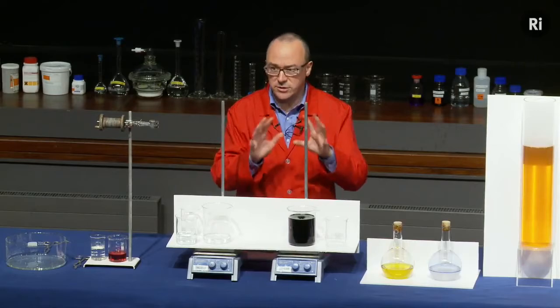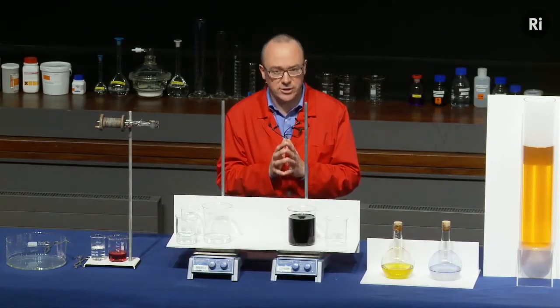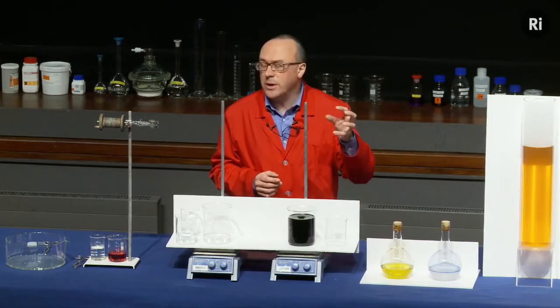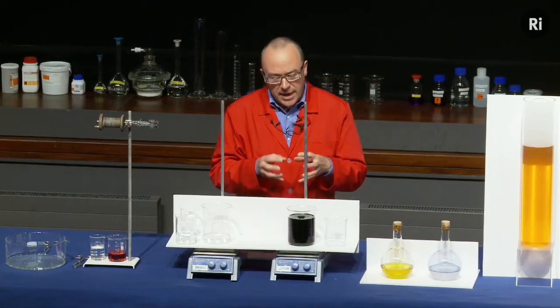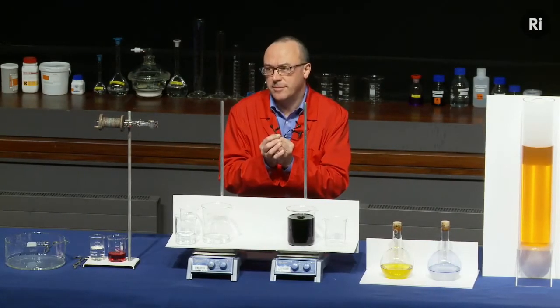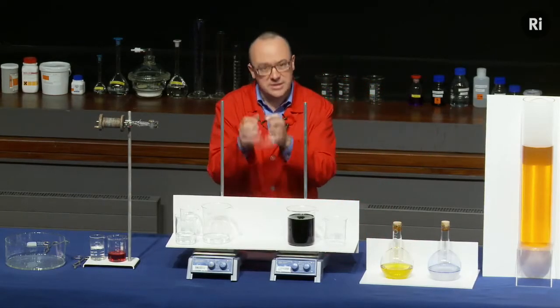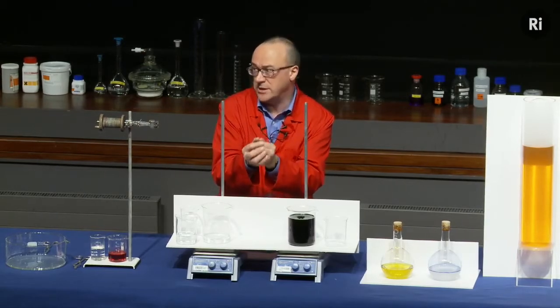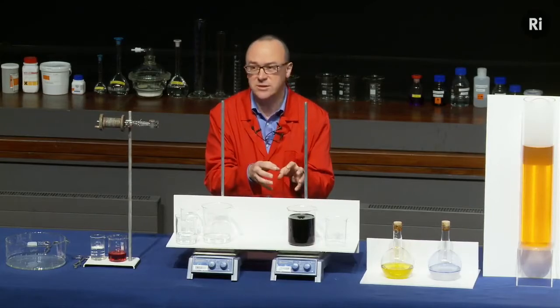So you imagine this reaction taking place and slowly releasing iodine into the solution. Now the iodine would appear as a sort of brown colour. You can't see the iodine because there's a second chemical reaction taking place. There's a material in the solution which is reacting very quickly with the iodine, and it's absorbing the iodine as soon as it's produced. And the secret to this is to arrange that that second material is in short supply.